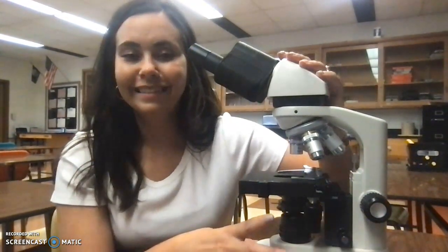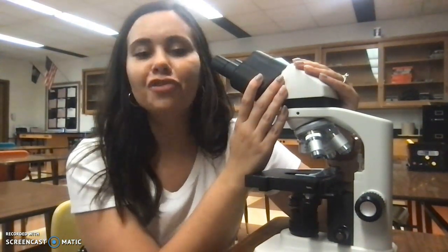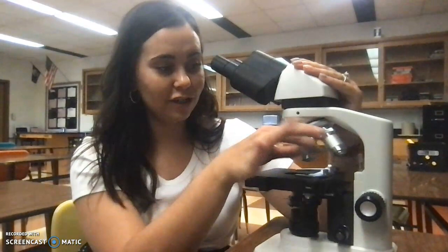Again, they're brand new. They're like $800 a piece, so please be nice to them. What makes them so fancy is that we have this oil immersion lens, which I didn't get to use till college, so you should be very proud of your biology knowledge. And then most of them have, after you plug it in, a little on-off switch here, so don't forget to do that.